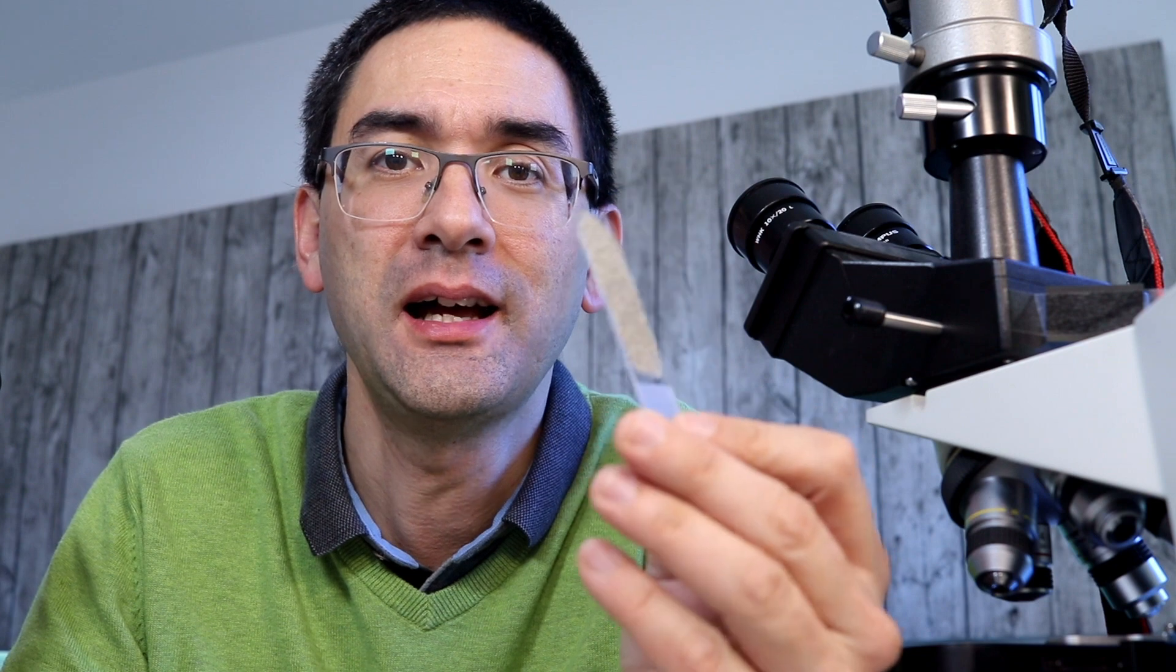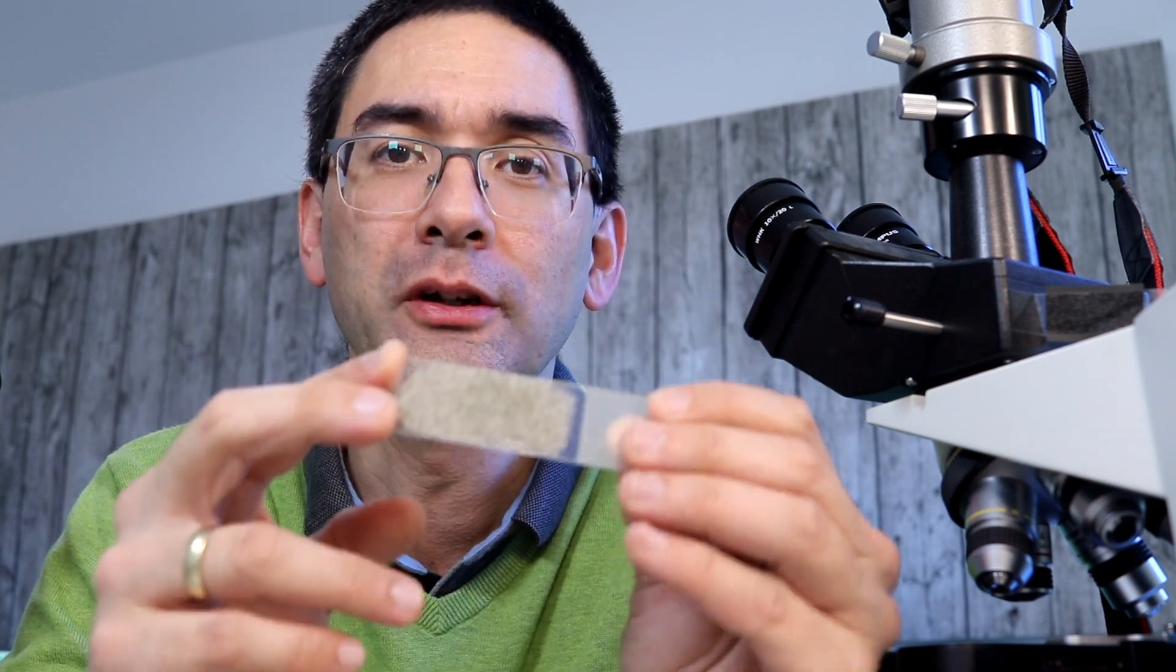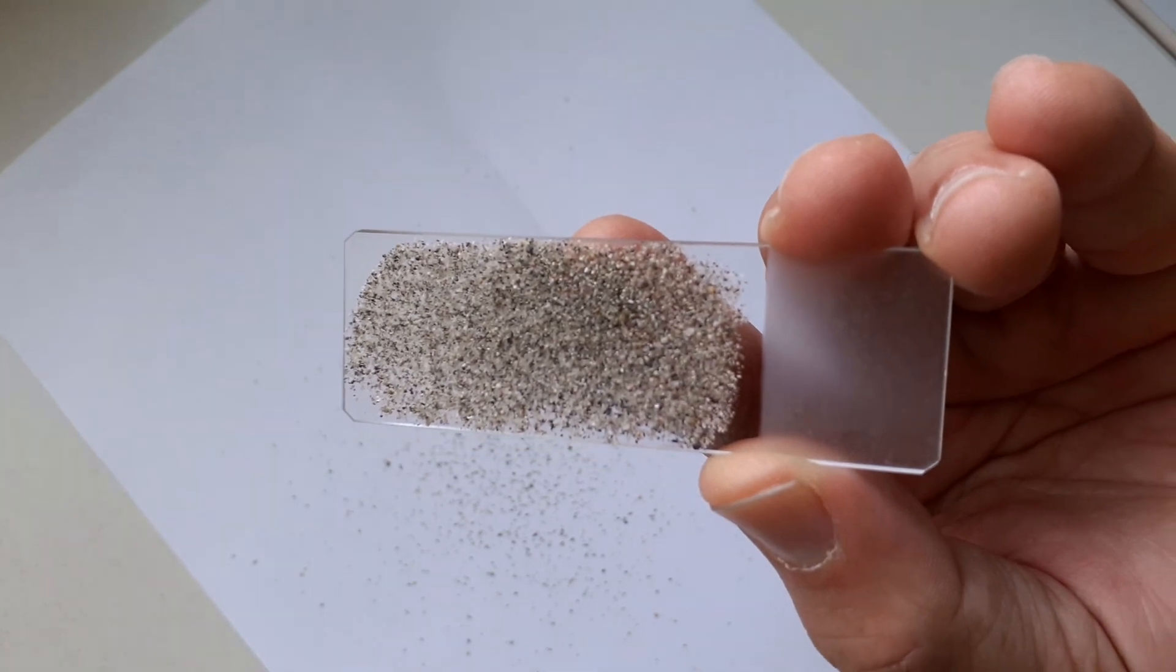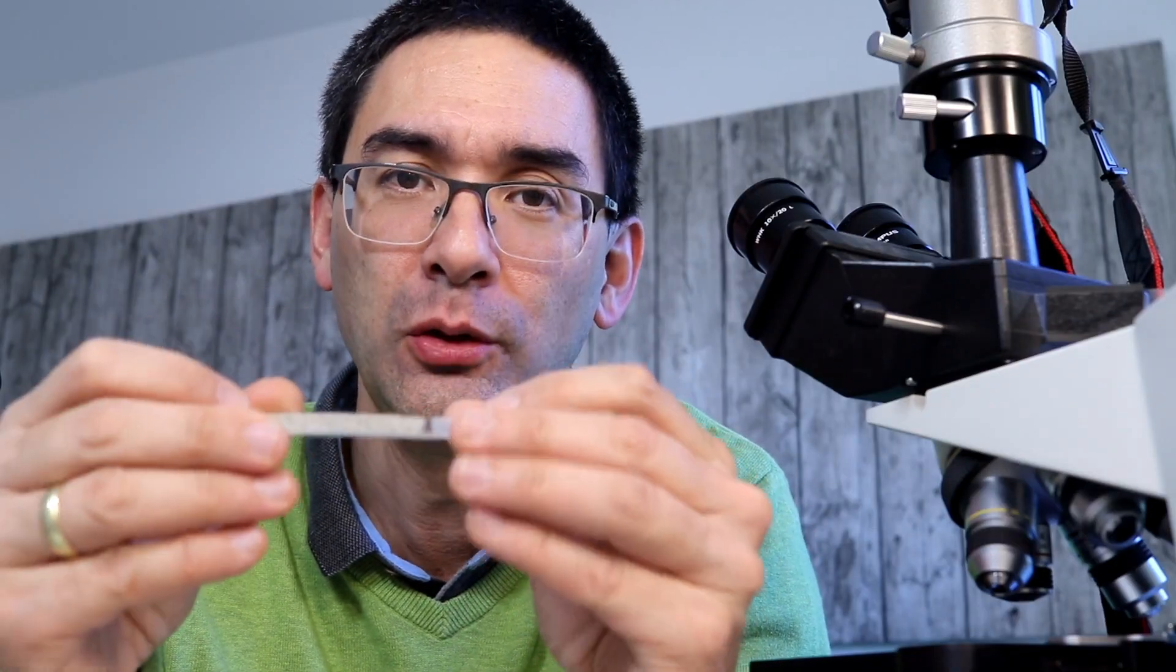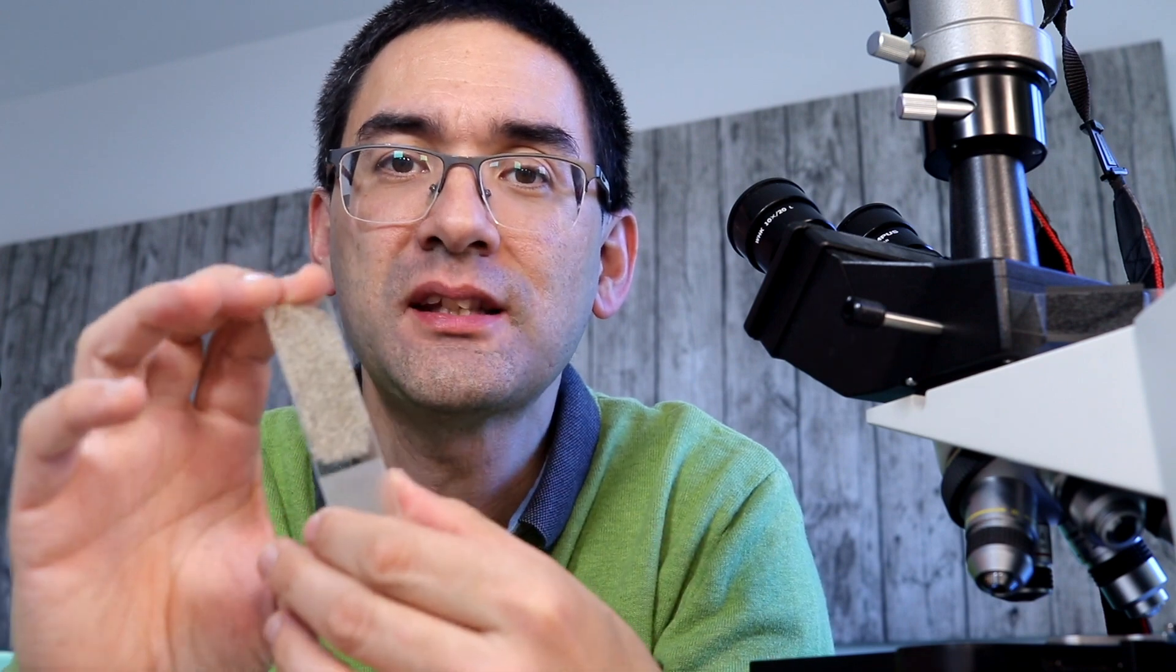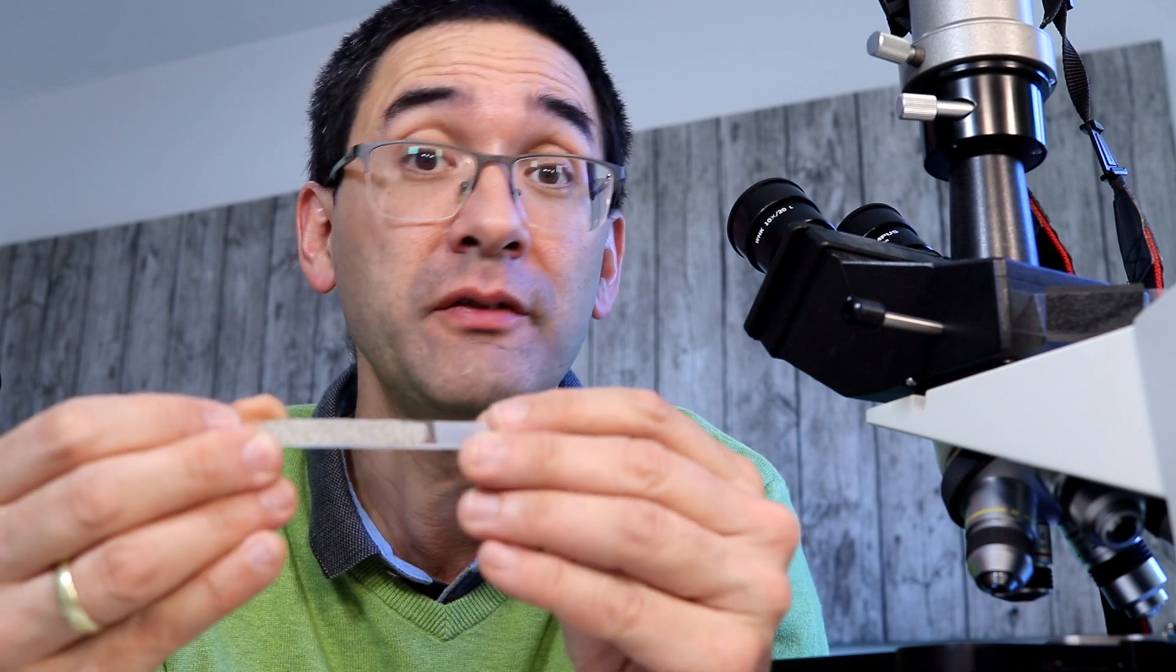This here is a slide where I mounted some sand on it using some nail polish. Now I got that idea from one of my viewers who recommended that I try this, and he told me that he's got several of these slides at home and some of the slides are already 100 years old or even older.